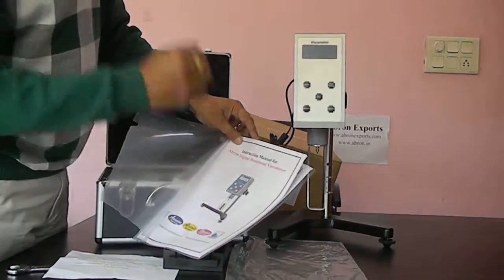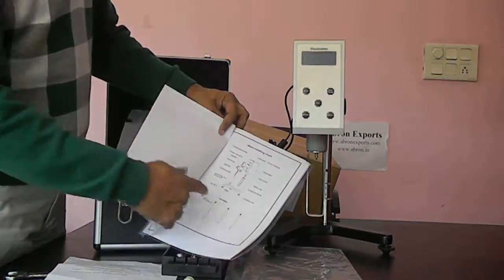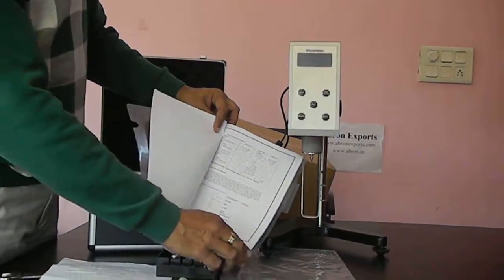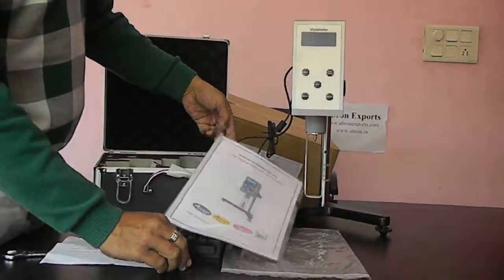There is a manual. We have given this manual. All these parts and working, you can do experiments as per your need.